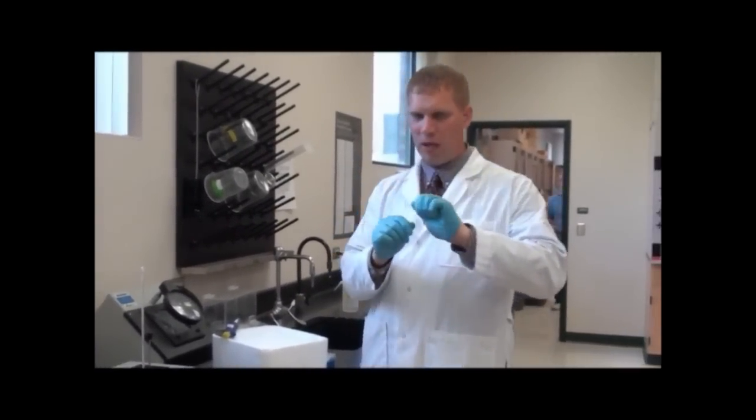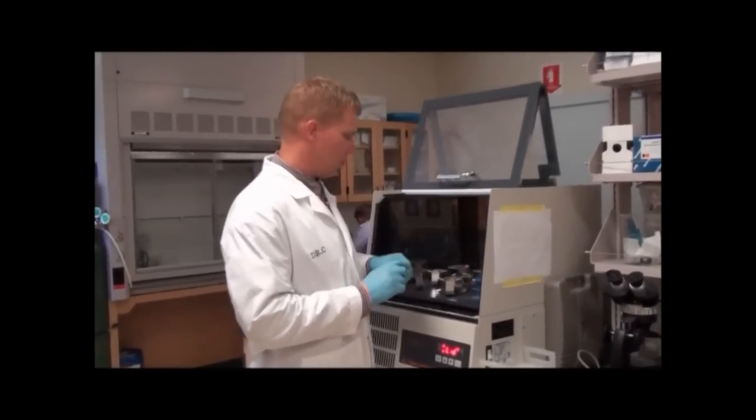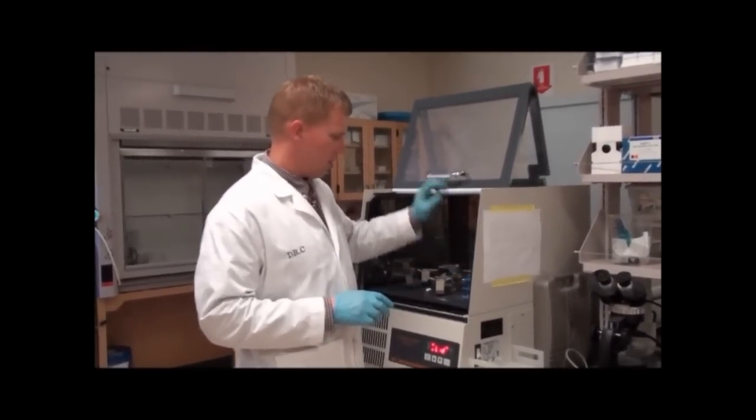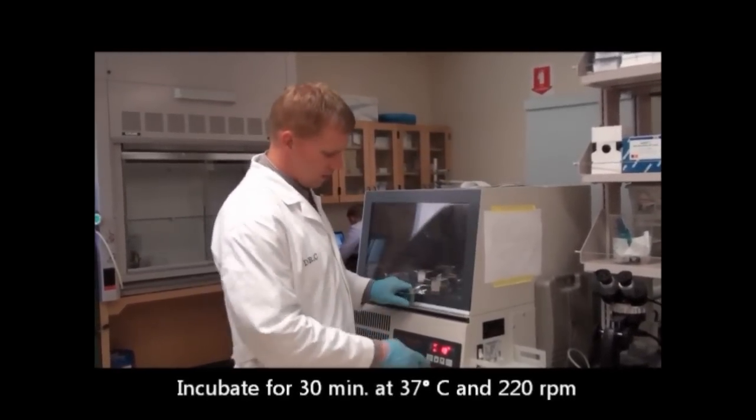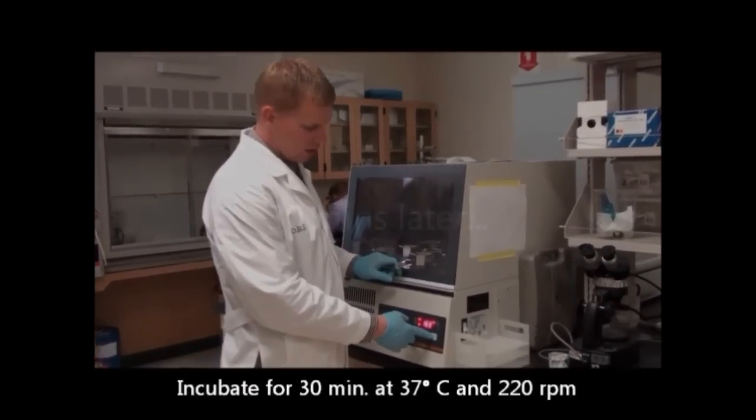My culture media I'm going to take and put on the 37 degree shaking incubator. This is the shaking incubator. I'm just going to open it up and put my sample here. If it's not already running, we want to set it for about 220 RPMs.